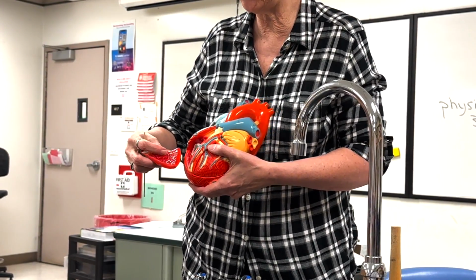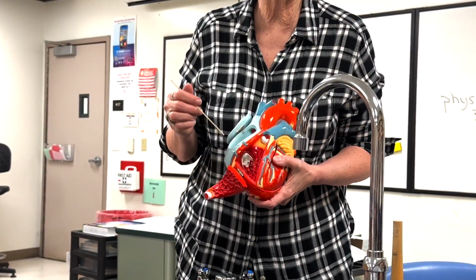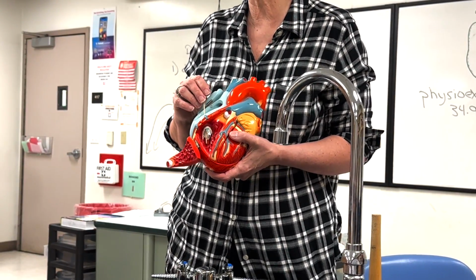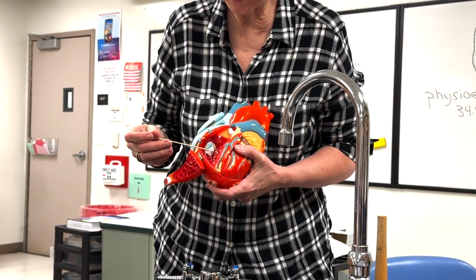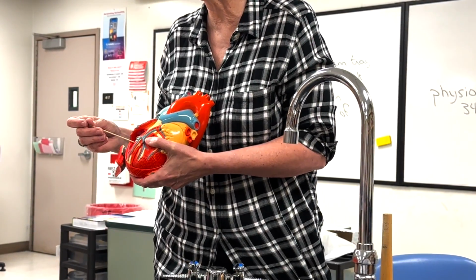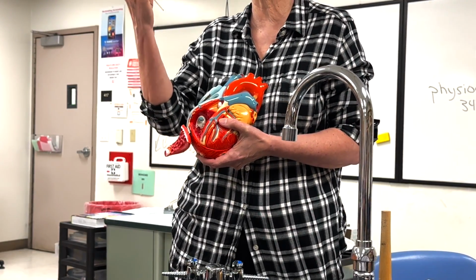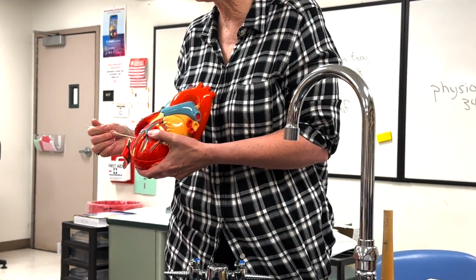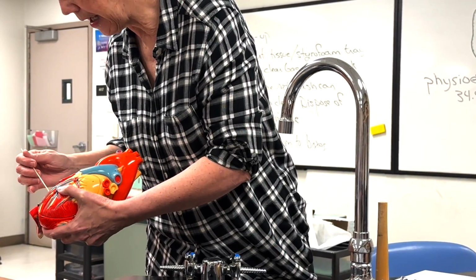And the ventricles, both right and left, have these trabeculae carneae. Okay, the right ventricle valve only has 3 cusps, and so tricuspid. I prefer to call it right atrioventricular, but tricuspid is fine. And connective tissue bands called chordae tendineae attach from the valve leaflet to papillary muscles. And those papillary muscles adjust the tension. They don't pull the valve closed. They keep it from blowing out, turning inside out. So they will adjust the tension. You'll be able to see them quite well in the sheep heart. So it's there and there.